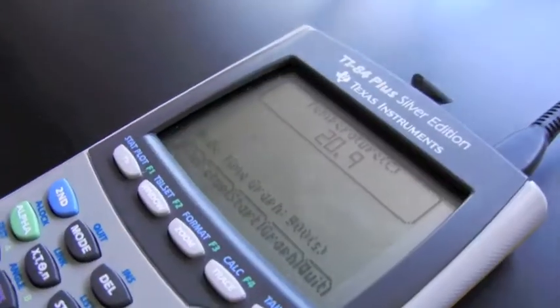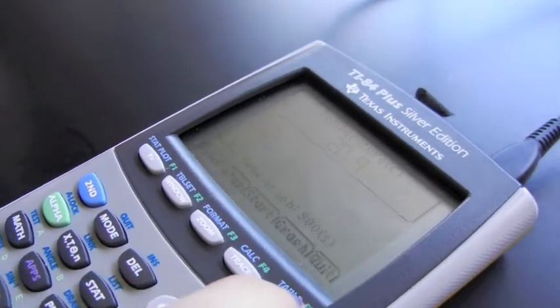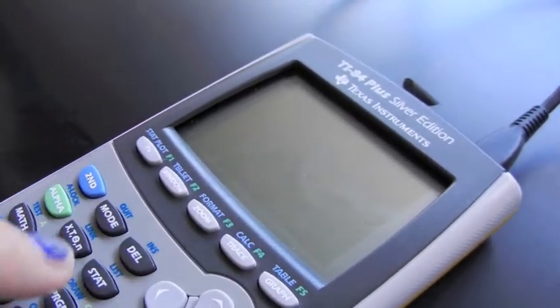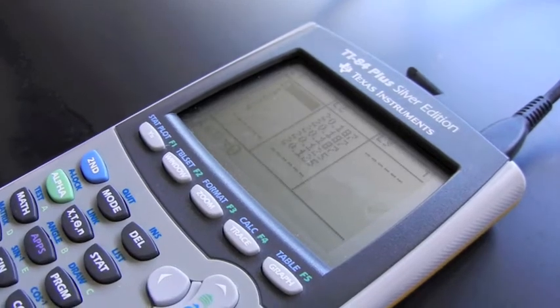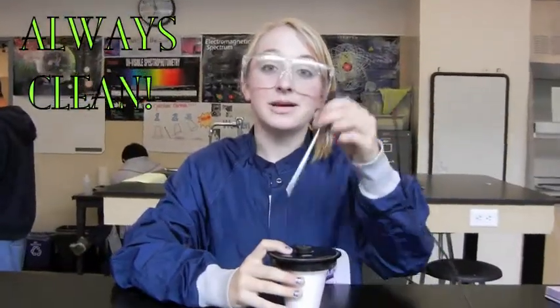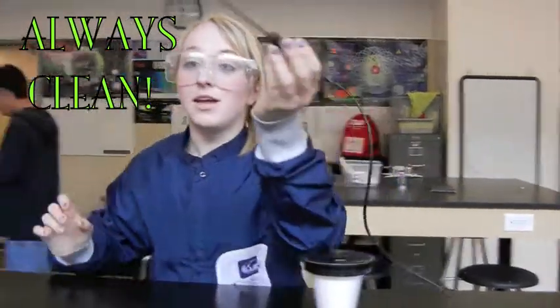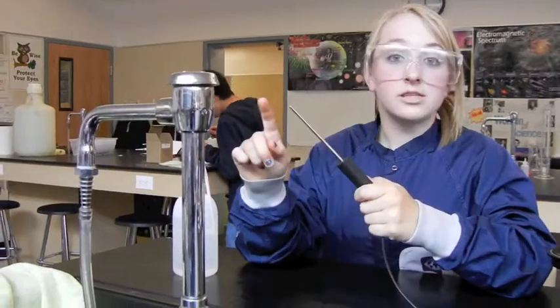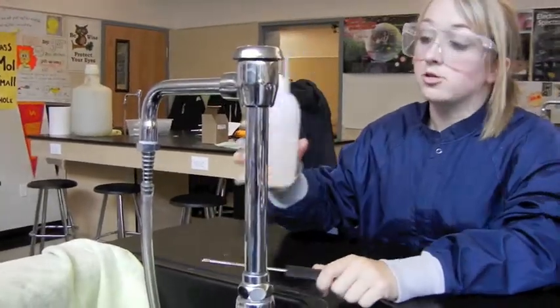Now, to get your data, you're going to hit Quit, okay, and then go to Stat, Edit, and your data should be in your list. In between experiments, make sure you wash your temperature probe, and be sure that you do not get any of the black part wet, only the silver part. Also remember to wash with distilled water only.